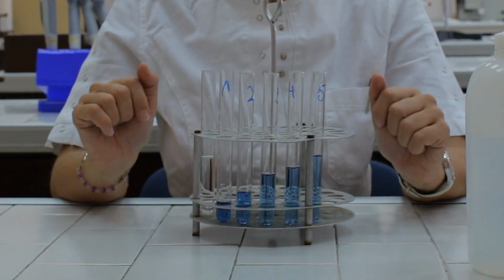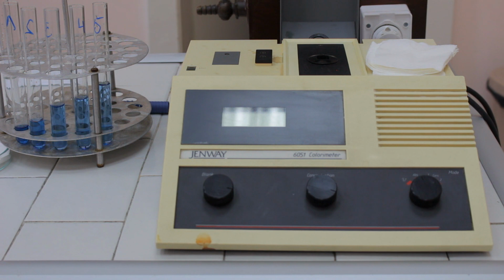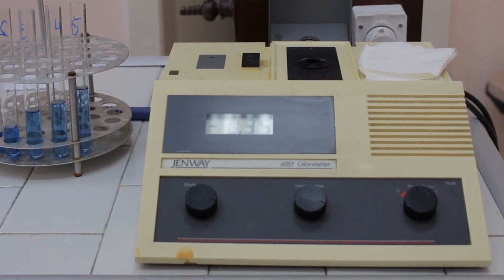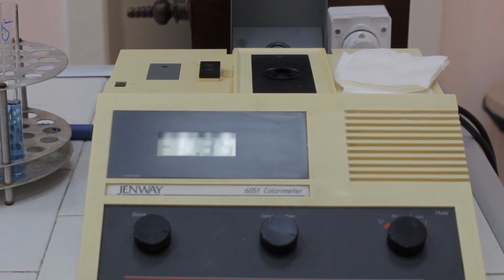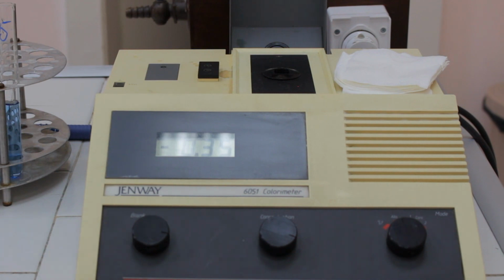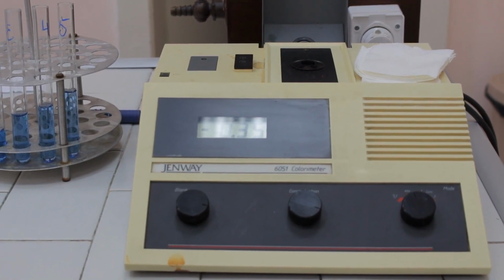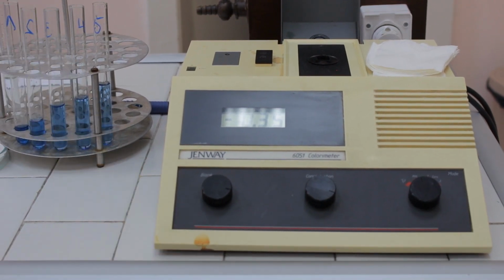Now we have to measure the absorbances of these solutions. So I'm going to explain the proper usage of the photometer. First we have to plug it in and switch it on by pressing the button at the back side of the instrument. Each photometer possesses several parts which are important for us and our measurements. First it has a lamp, then the compartment to which we are going to place the cuvettes, then the wheel which serves for adjusting the proper wavelength, the display which shows the read absorbances, and the wheel which is used for setting the zero of the instrument.